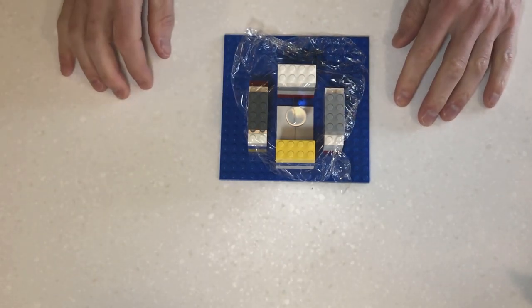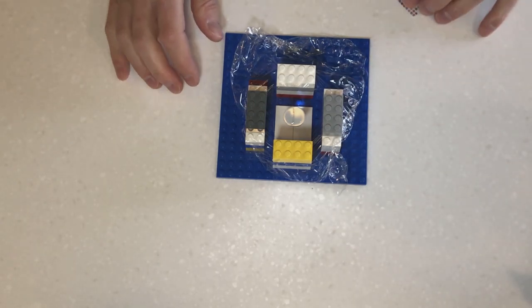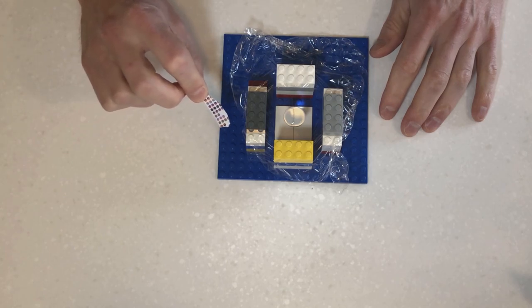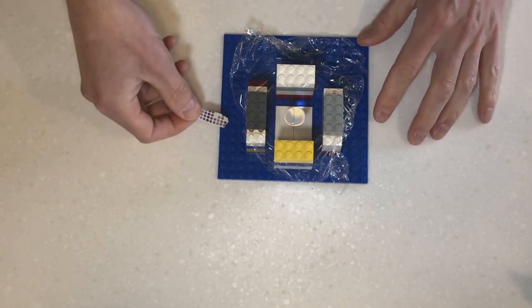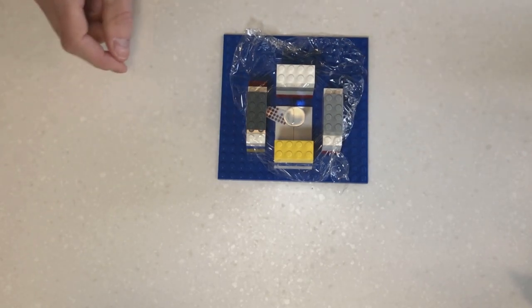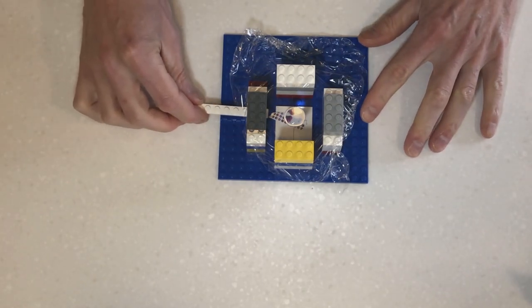Okay, the next thing to do is now introduce our sample into the microscope. Now my sample today is just going to be a piece of paper with some coloured dots on it. Now these coloured dots are made up of even smaller dots, and hopefully the water lens will show these. So I'm going to move them into my microscope and use this smaller, thinner bit of Lego to push them around.